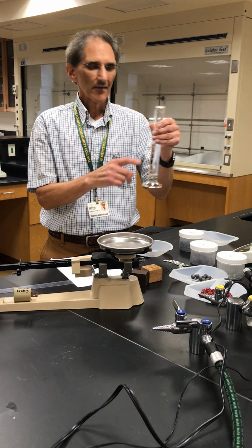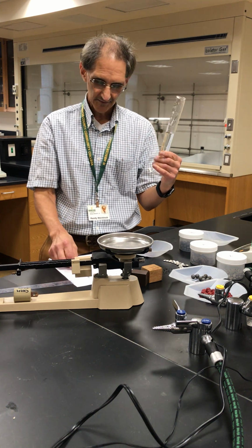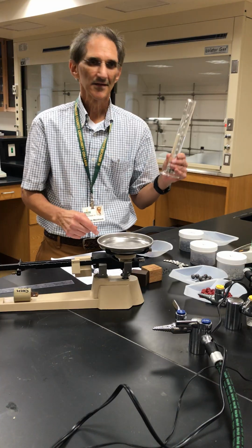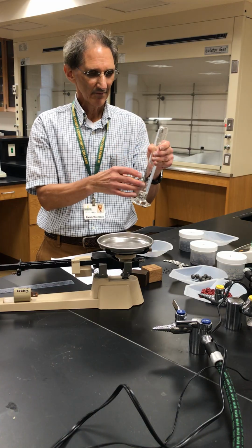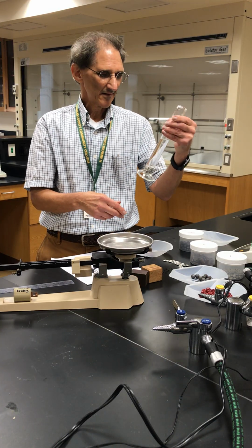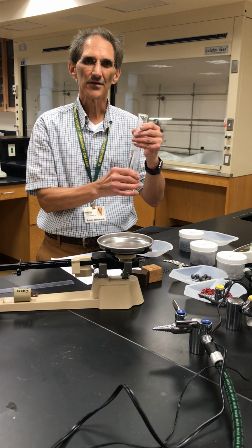Now, the volume of these pellets that I just put in here is the difference between the initial volume at 60.00 and the new volume. Right? So the pellets displace the water, and the difference is the volume of these. Pretty ingenious. There's a guy named Archimedes in ancient Greece who figured that out, that a material will displace its volume when submerged in a liquid.